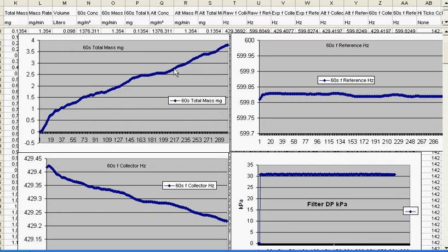This total mass is corrected on by the change in pressure of the filter. As the pressure loads up, the pressure within the collection volume decreases, thereby decreasing the mass of the resonant structure. So now you have an overview of that. I'm going to expand this screen a little bit.